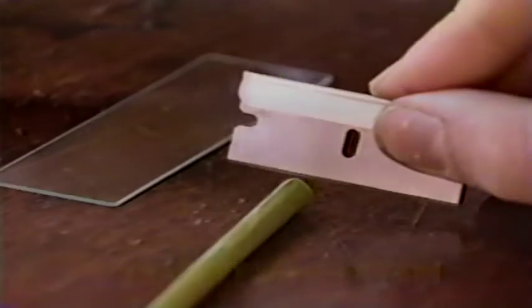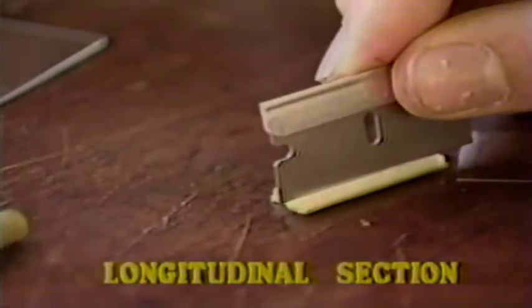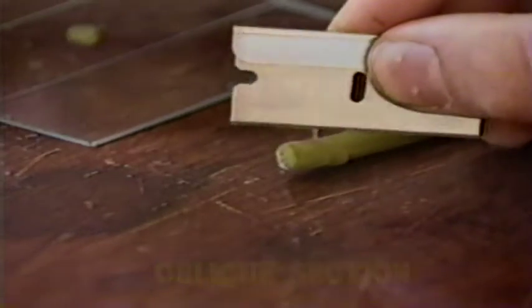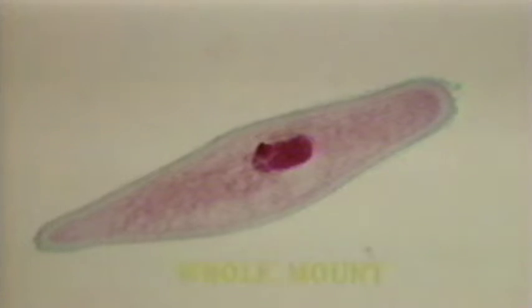Sections can be crossways or transverse, lengthways or longitudinal, or at an oblique angle. Sections placed on the slide in the order they were prepared are called serial sections. When an entire unsectioned sample is examined, it is called a whole mount.